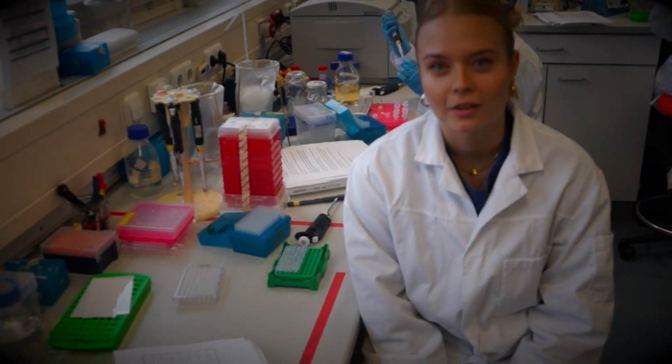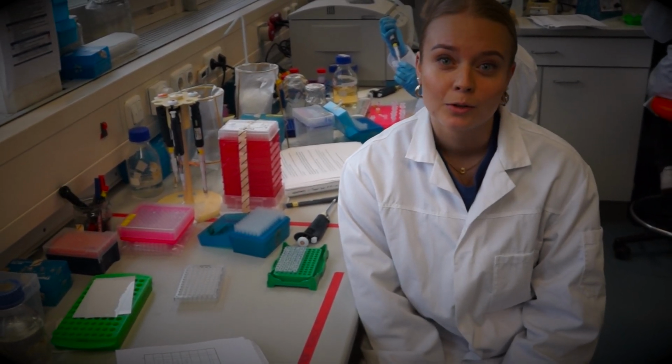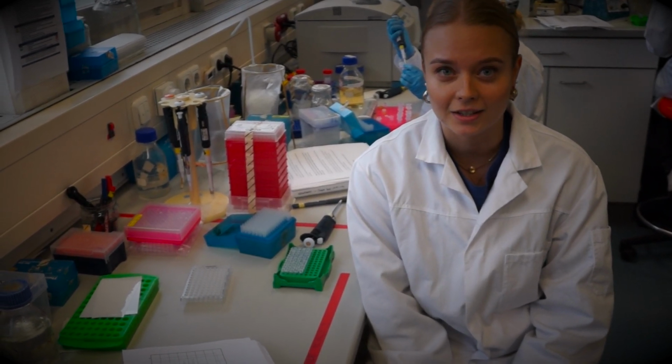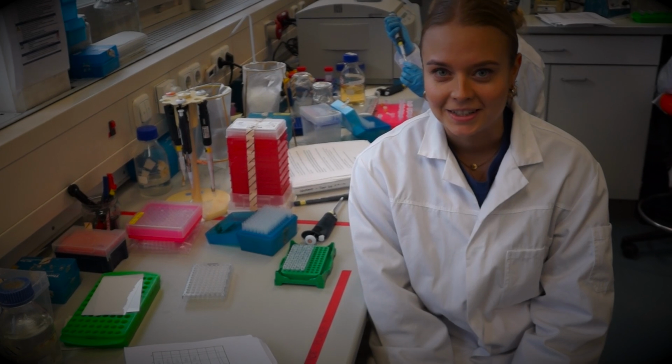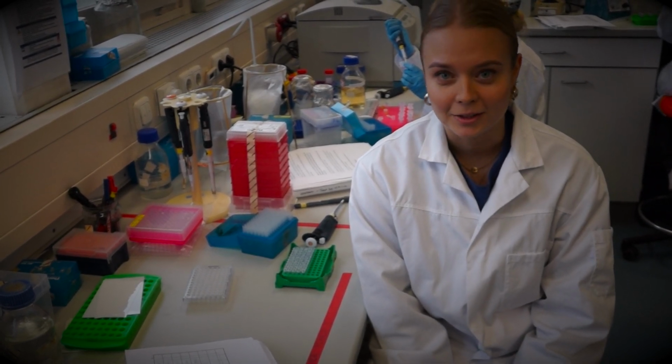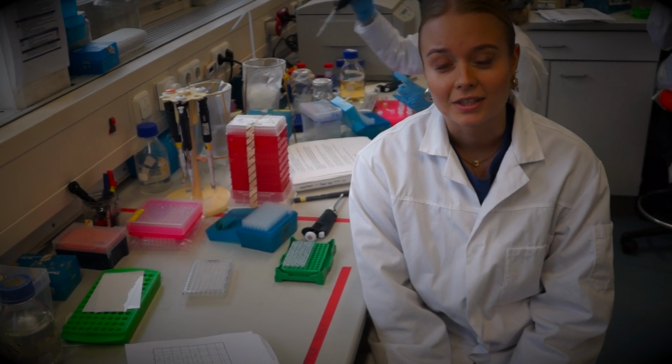So my name is Emily, and I study at the Technical University of Munich, and I'm doing my bachelor's thesis here at the Helmholtz Institute at the Comparative Microbiome Department, short COMI. And I'm working with around 100 samples to research the impact of florfenicol, that's an antibiotic, and emamectin benzoate, that's an antiparasitic, on the gut microbiome of sea urchins.